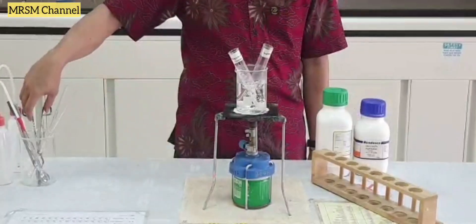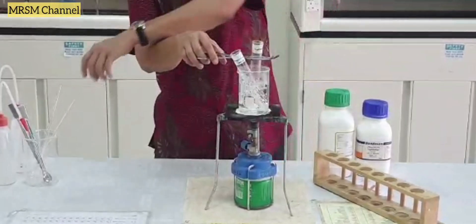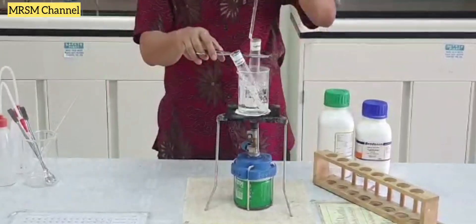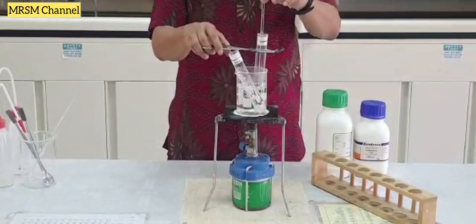Let's wait for a few minutes. While waiting, you can also stir the compound.